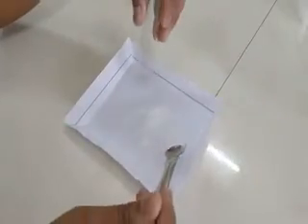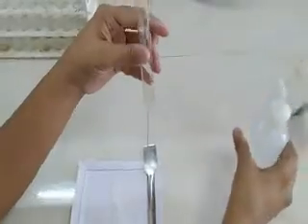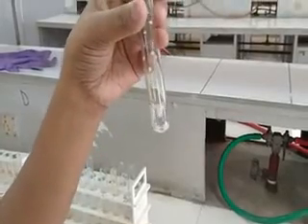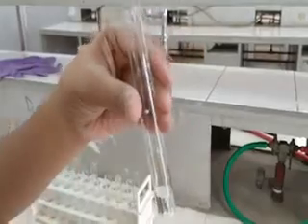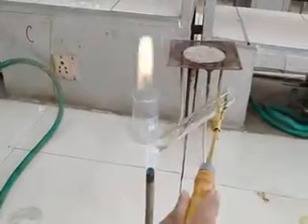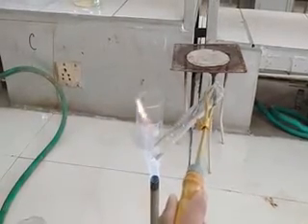We will carry out the solubility test. For that, we will take a little bit of the organic sample in a test tube and add the first solvent, that is cold water. As you can see, the organic sample is not at all soluble in cold water. We will proceed to the second solvent, that is hot water, and warm it using a Bunsen burner. As you can see, the organic sample is not soluble in hot water either.